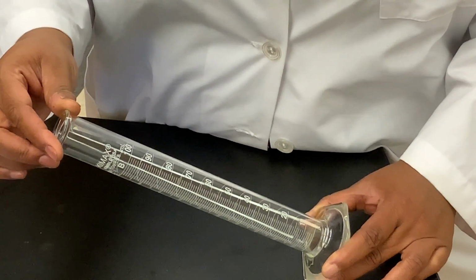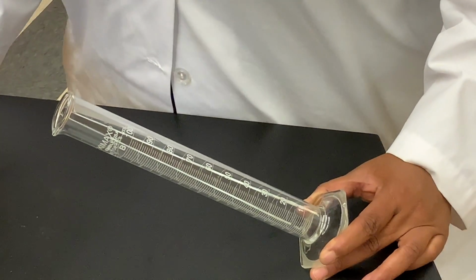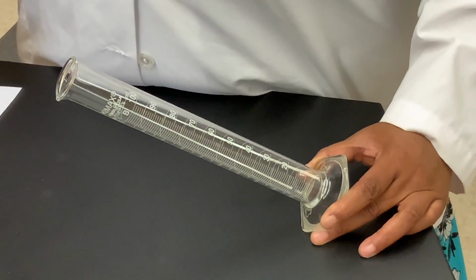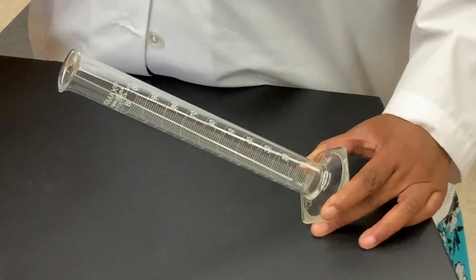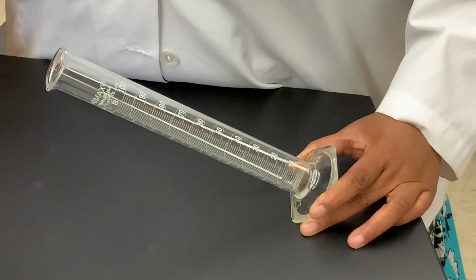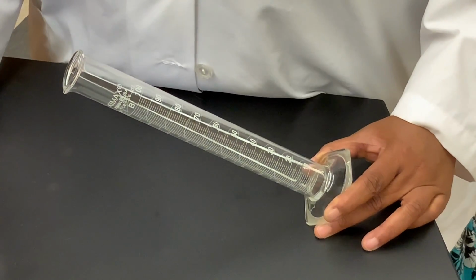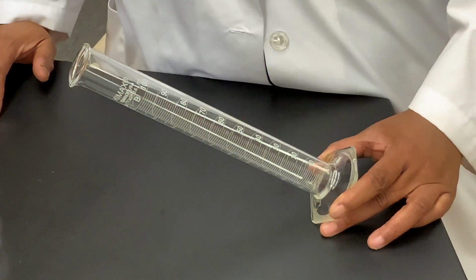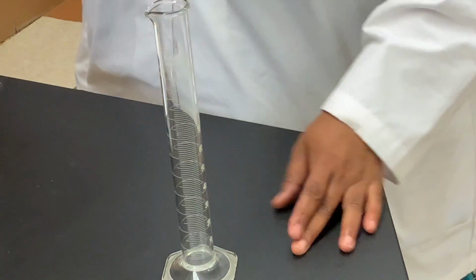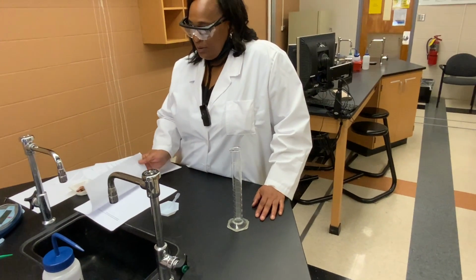And so while examining this graduated cylinder, go to your second set of inquiry questions, and you will answer those questions based on your visual inspection of this graduated cylinder, and also based on the picture that you see within that data set 2 set of questions under letter number L. So again, go to your data set questions, set 2, answer questions letter number H, all the way through letter P.